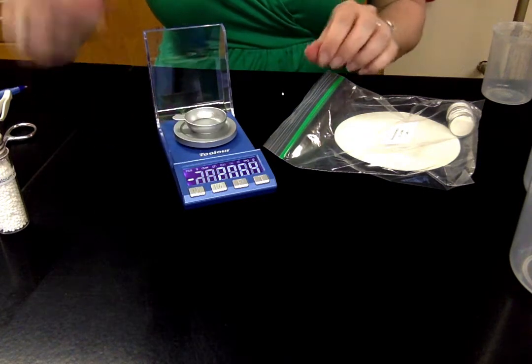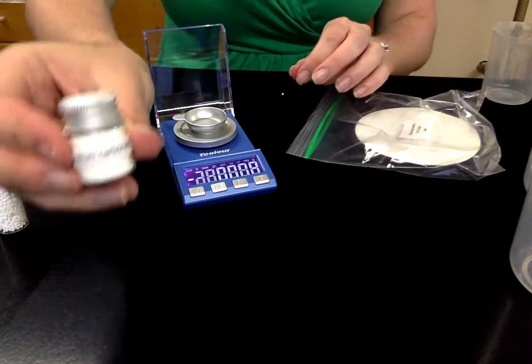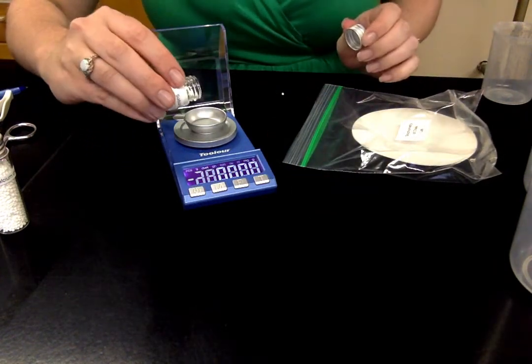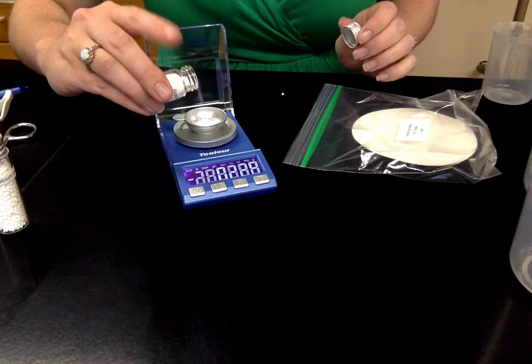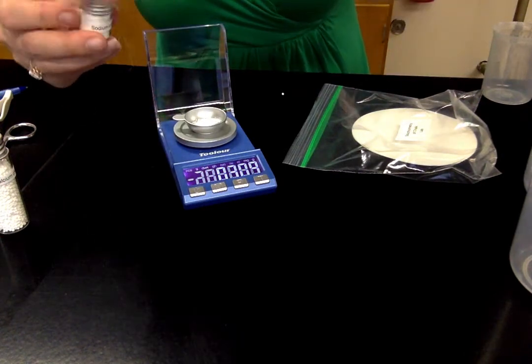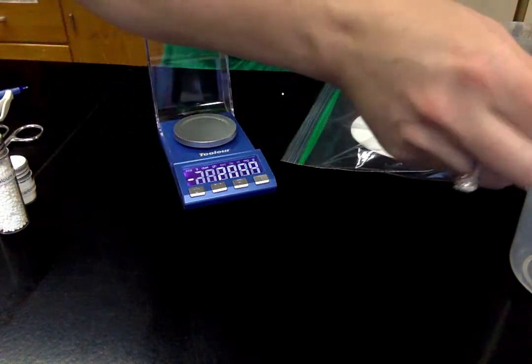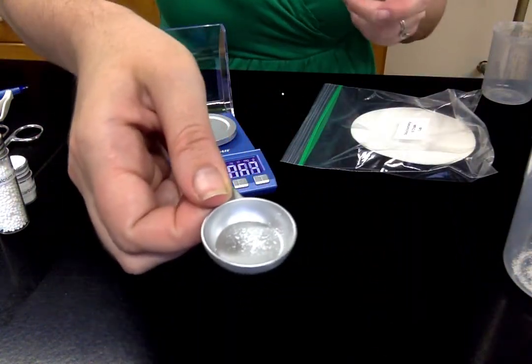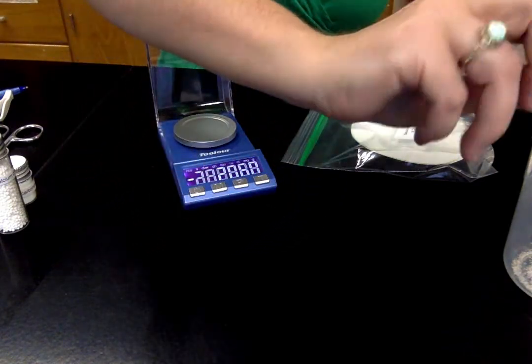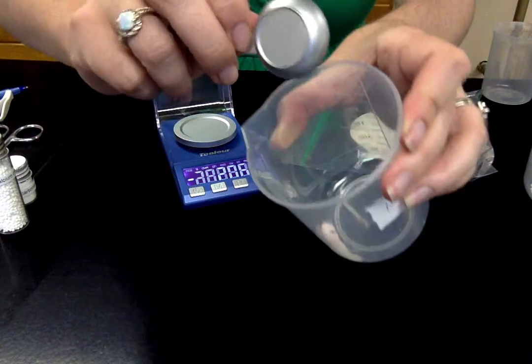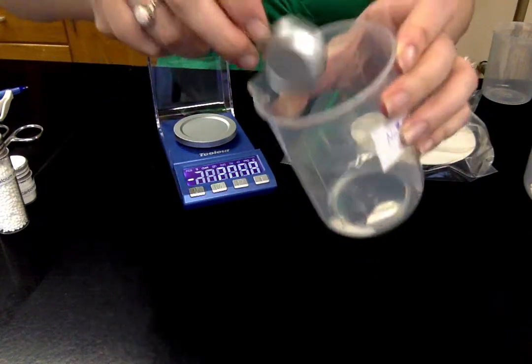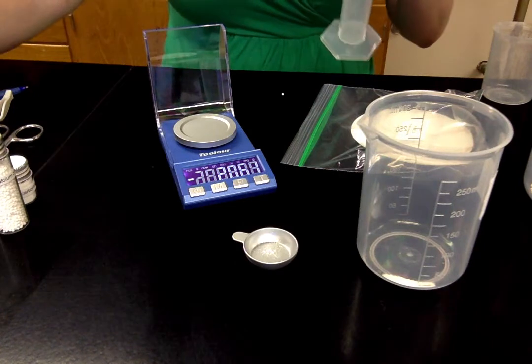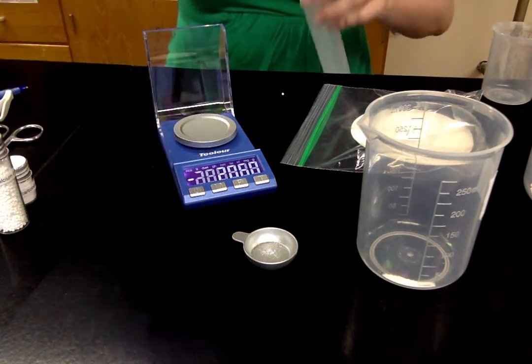So I wipe that off with a damp towel and now I'm going to measure out my sodium carbonate in the same way. I'm going to tare my scale. It's tared. And I'm going to measure out a certain mass of that. Again I'm not giving away what that is. I didn't even look. I'm just doing random amounts here in this demo. Some of it's sticking to the weigh pan. So I might take some water and put that in here and dump it because I want all of that powder going into my solution. I don't want to lose any. That would be some room for error there.